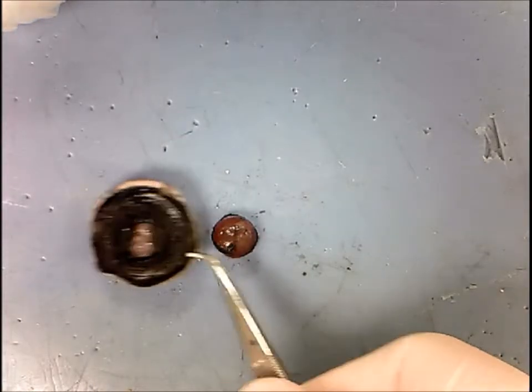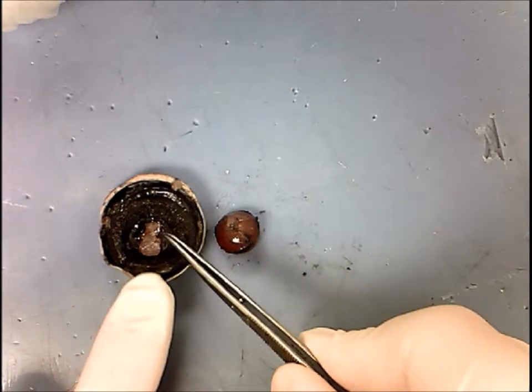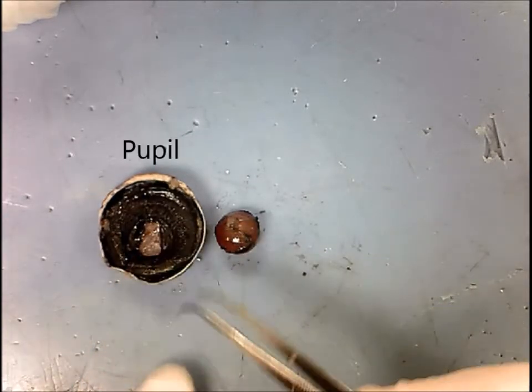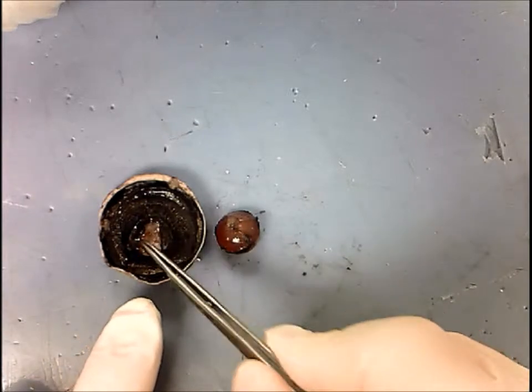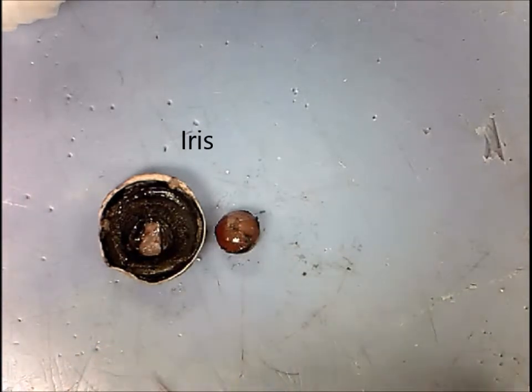Looking at the backside of the eye, you can see the opening called the pupil, and then surrounding the pupil you can see the iris.